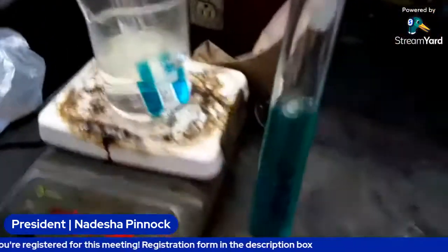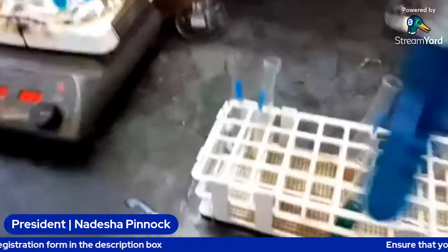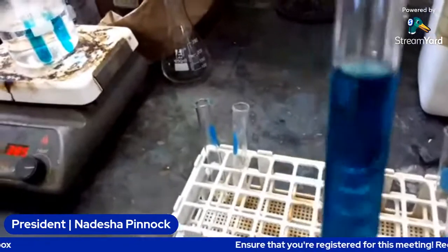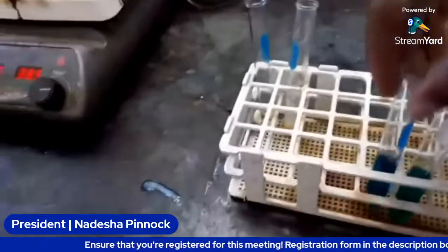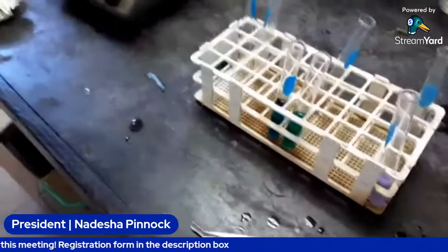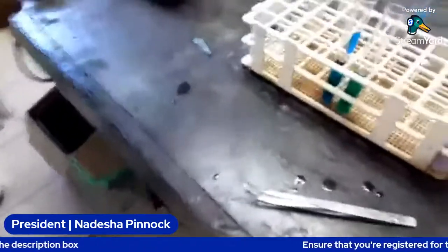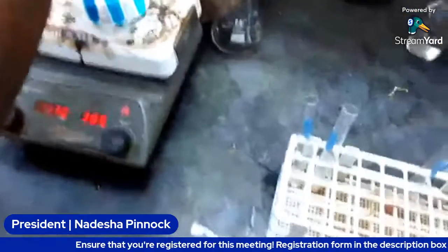So we're going to add them to the water bath. This one looks very bright in color just because the syrup was red and I added the blue. So now add those. All right, so we're adding those to the water bath as well.